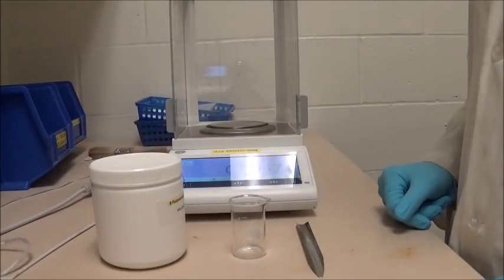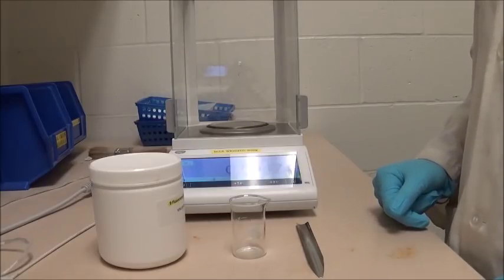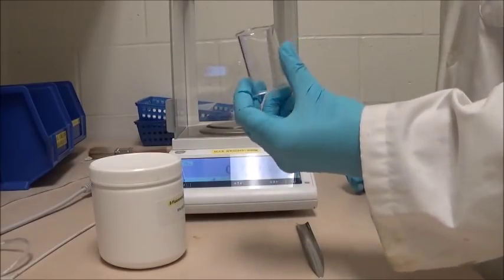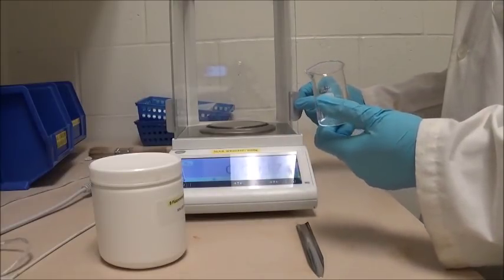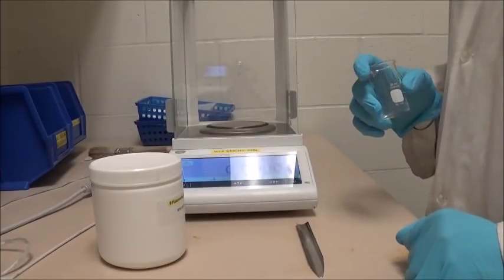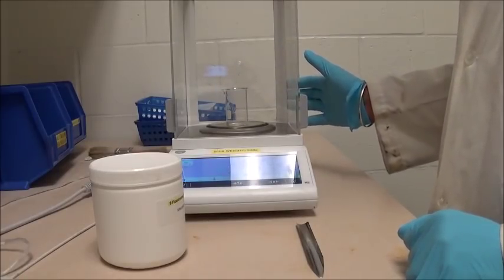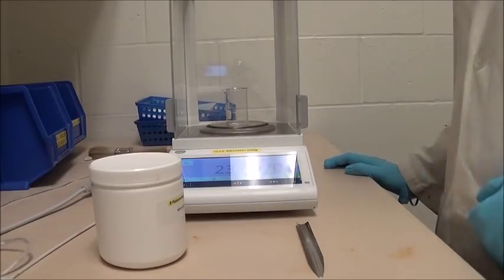After we have set the water to start boiling, we can start measuring how much 9-fluorenone we'll be adding to our solution. To do this, first we're going to be taking our 25 milliliter beaker and measuring the mass of that. So first we will be zeroing or taring our analytical balance, placing the beaker, and now we'll be recording the mass of this beaker.